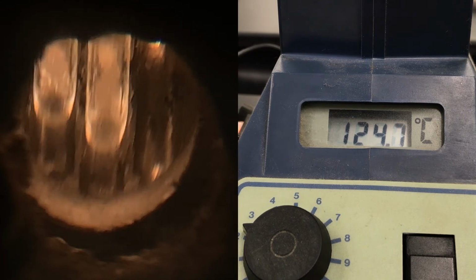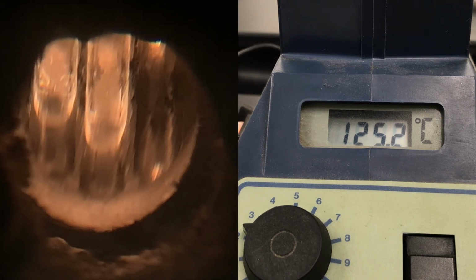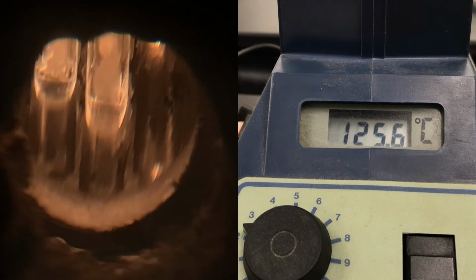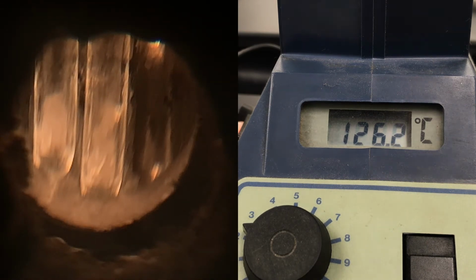It seems to be in focus when I hold the tubes higher up, so it's hard to see it when they're down because of all the lenses involved here. There's a magnifying lens in front of the viewport, and there's also the lens of my camera. Let me try to get the rate heating up just a tad bit more.